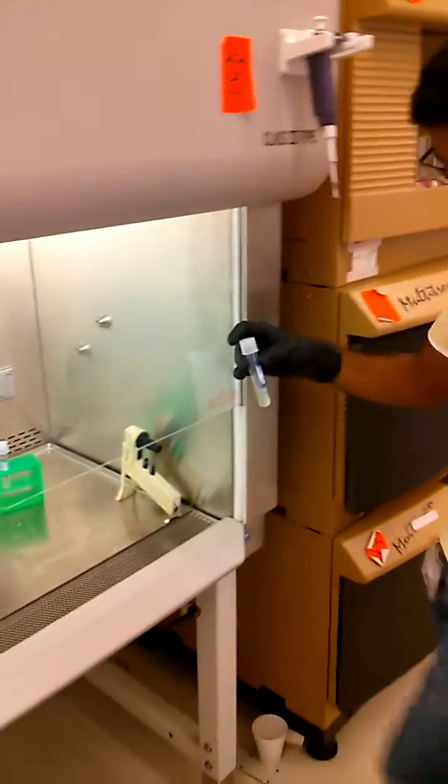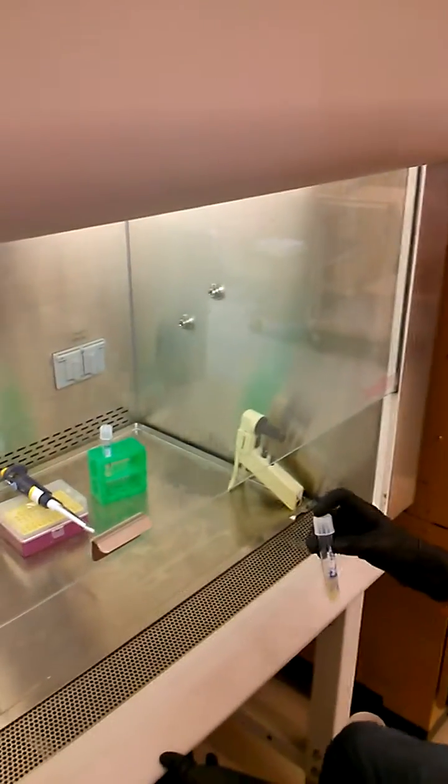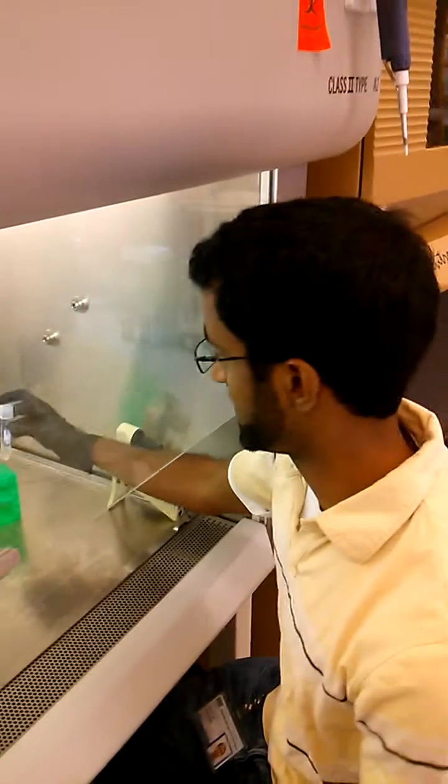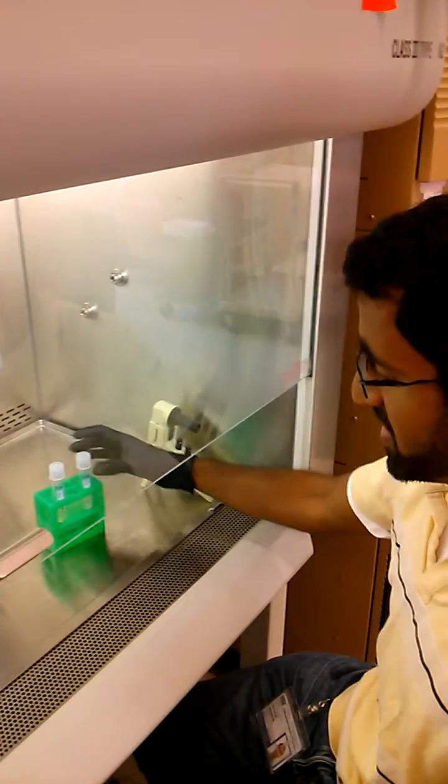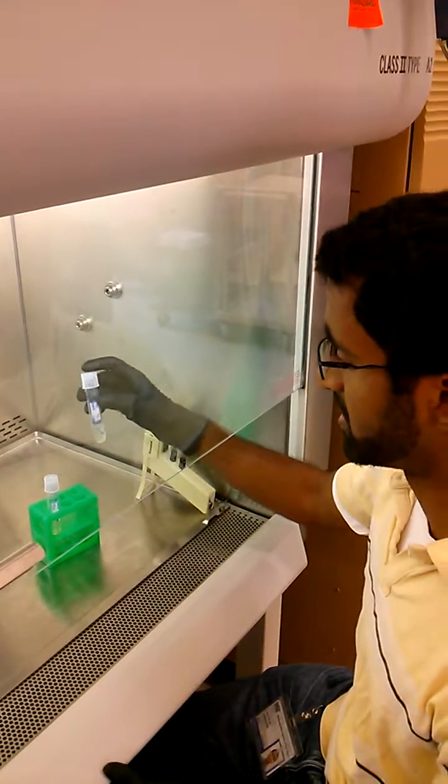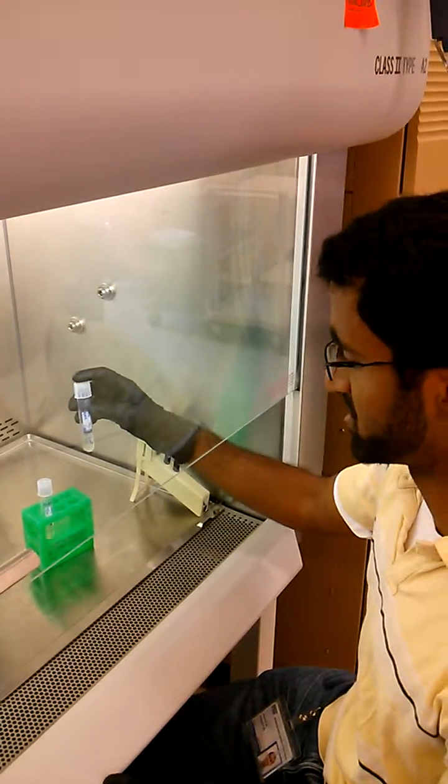And I'm just going to start a new culture of this because when you add the P1 phage, you want your cells to be very young, so very early exponential stage.